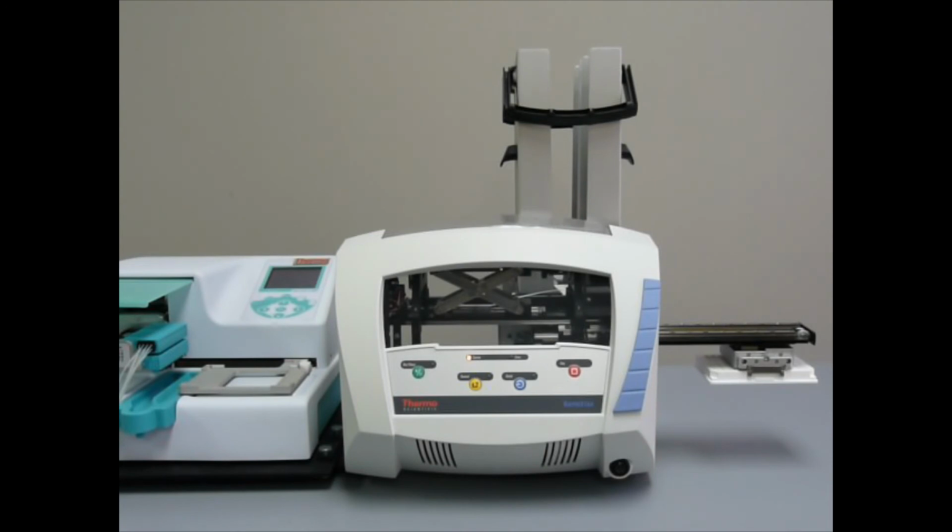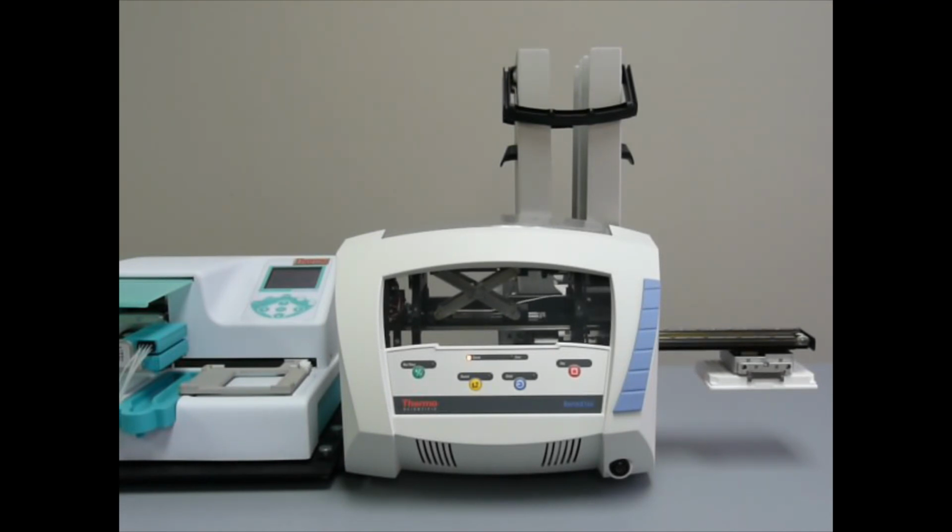I'll adjust the movement a significant amount down. I'll just jog the arm now. I'm going 100 points down. And I'm going to go another 100 points down. And one more. And we'll go 500 points to the left.